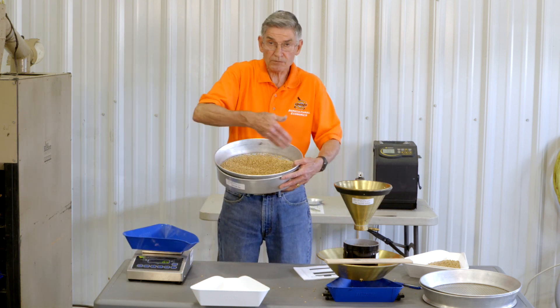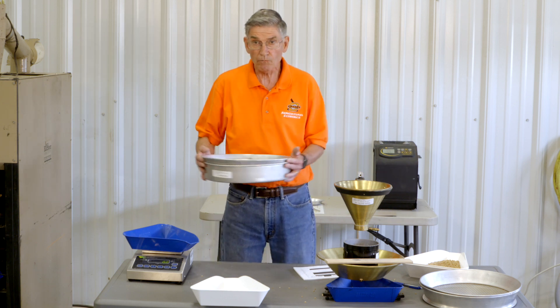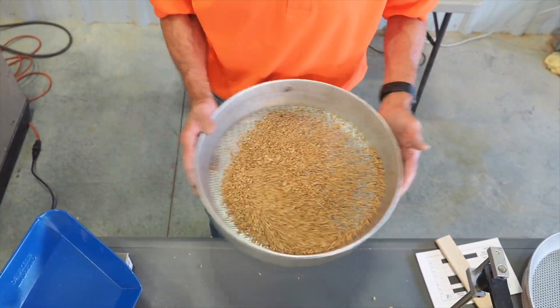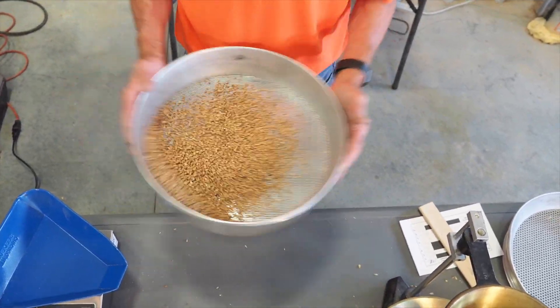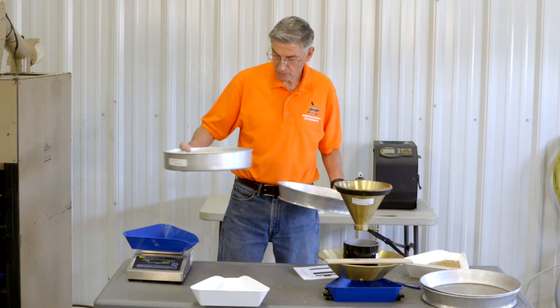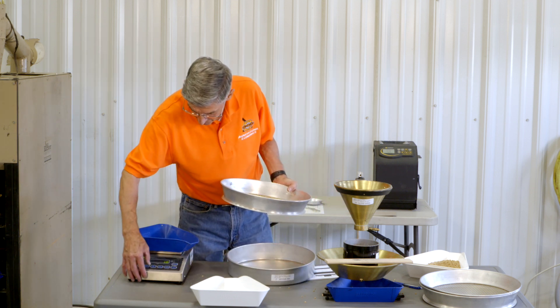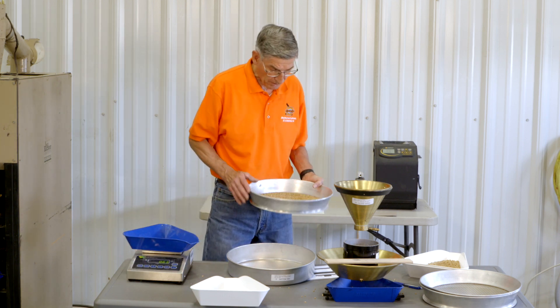I want to keep the slots parallel with my body and I want to do 28 revolutions — counting 1 through 28. Now I've got my shrunken and broken. I have 1.6 grams, or 0.6% shrunken and broken.